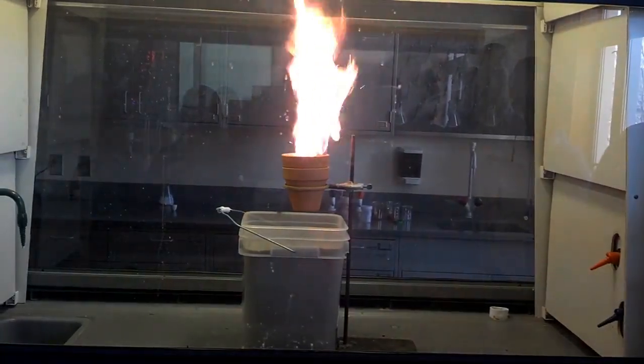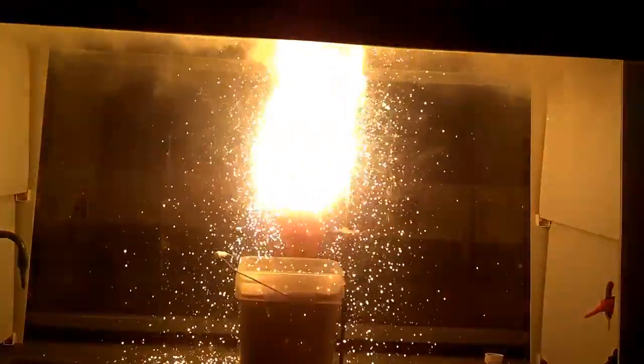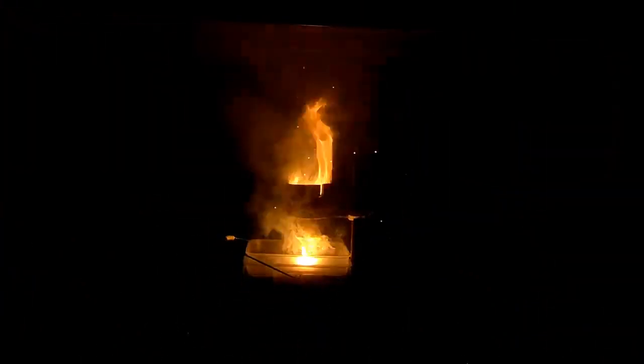Oh, just wait. There's one that bad. That's so cool. It cracked the pot. It laid its eggs.